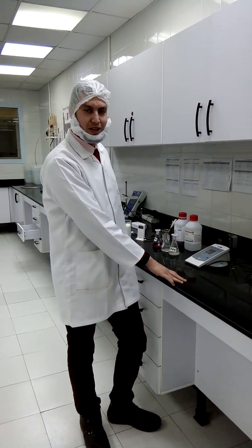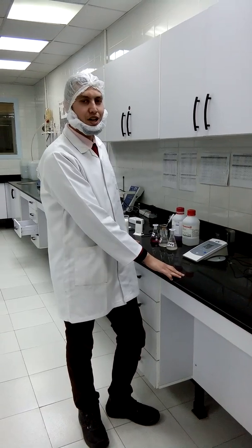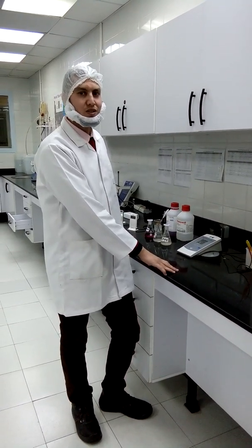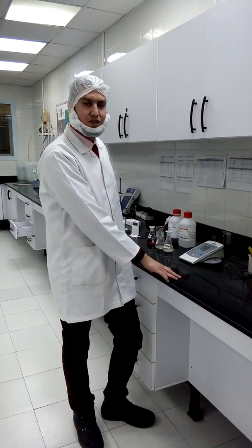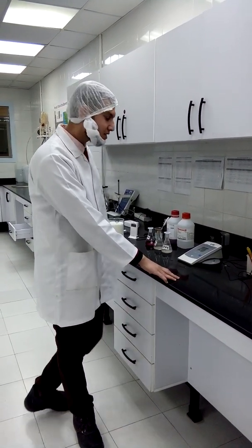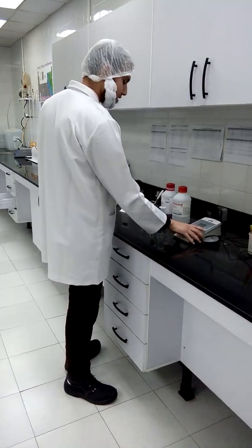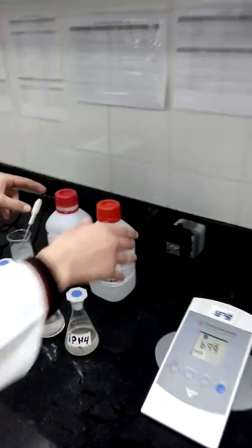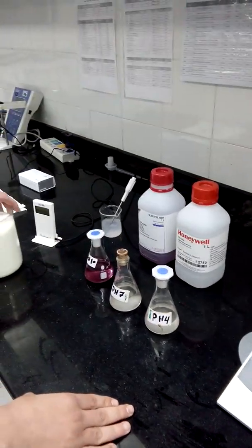Our sample is milk, and milk pH ranges from 6.6 to 6.8, plus or minus 0.1. This is our pH meter and these are our buffer solutions. So we want to measure the pH of the milk sample.